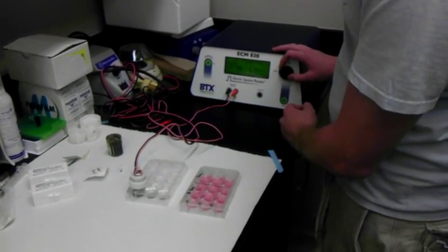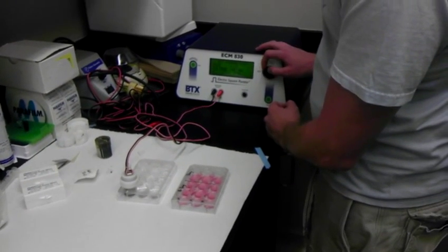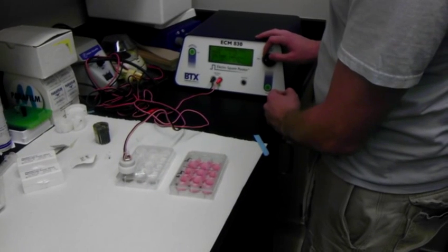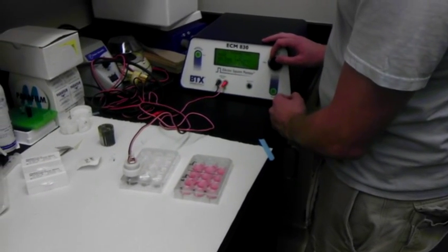Then we're going to change the settings to voltage. It's going to be 160 volts. It moves very fast, so you've got to be careful. It'll get you.